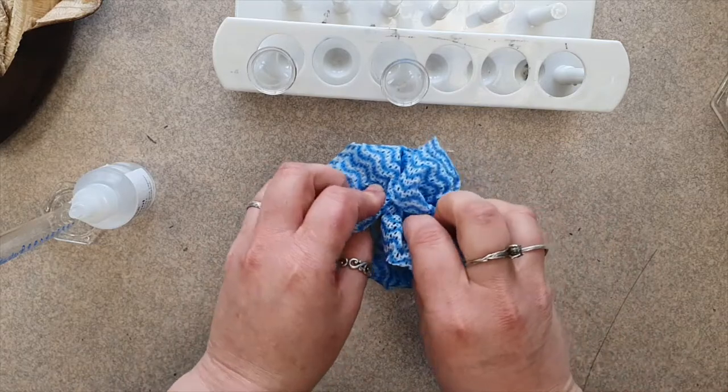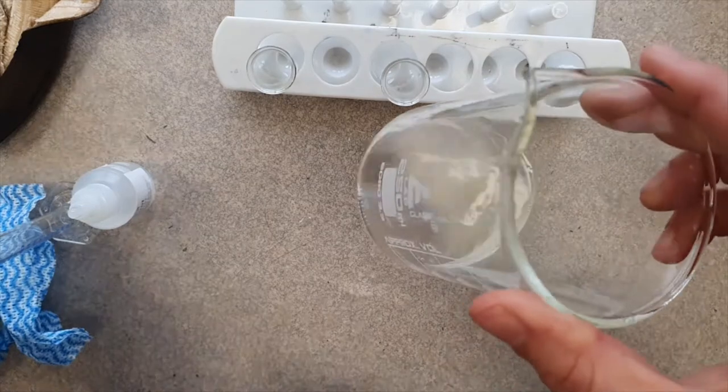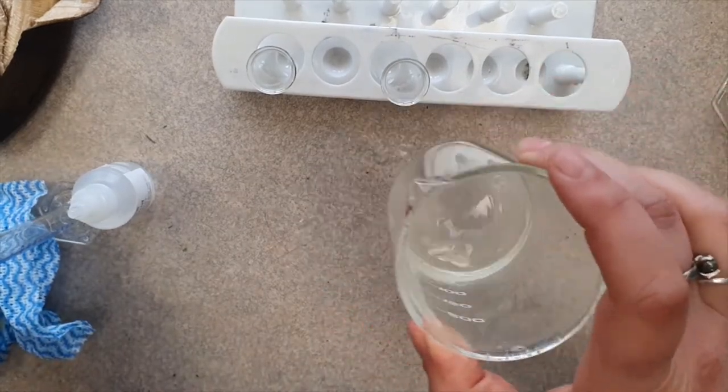I'm gonna take this off. Look at that. A bit of a clearer liquid.